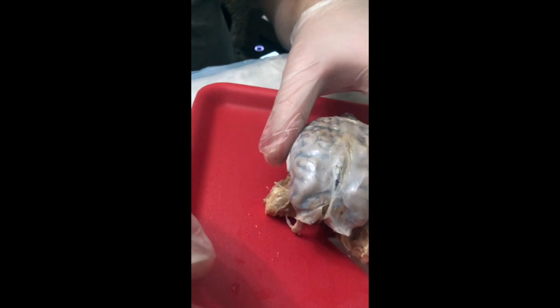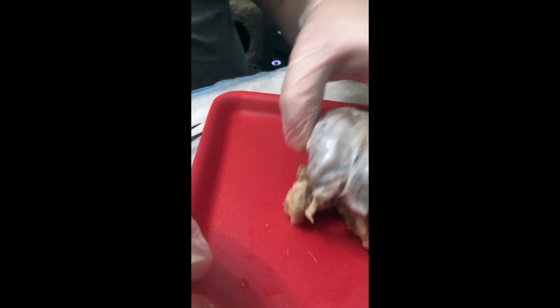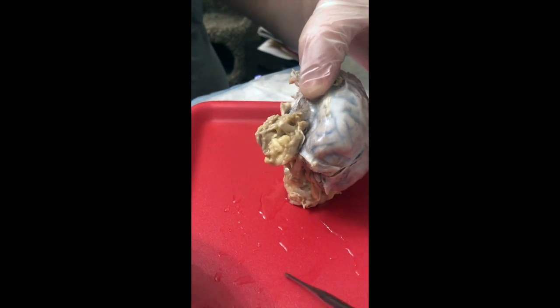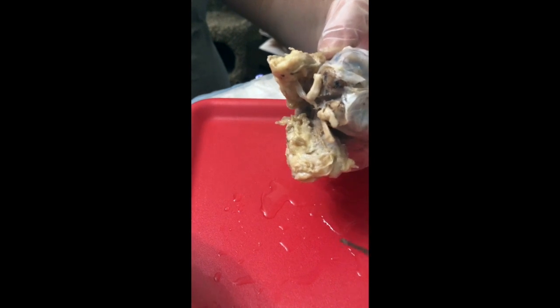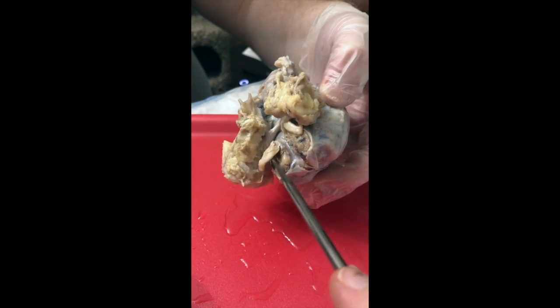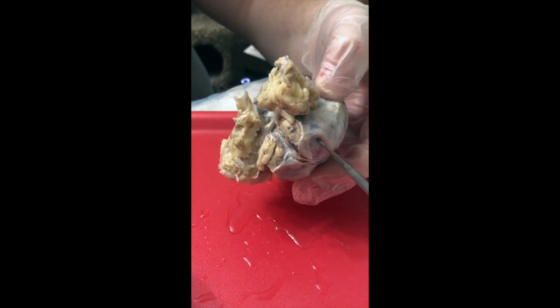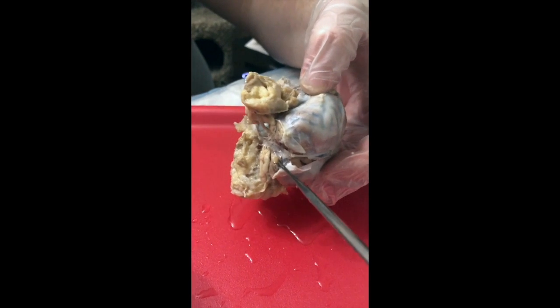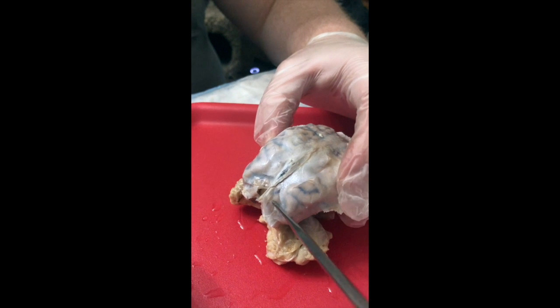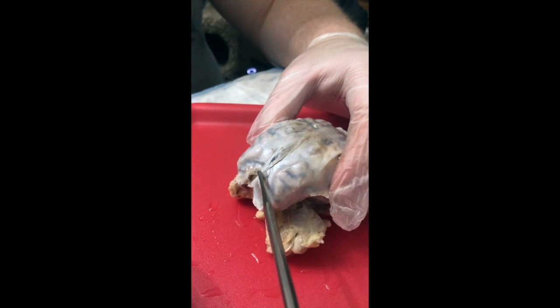On the anterior end, which will be the tip of the frontal lobe, we have two large fat pads, and those fat pads are going to be the cushions that sit at the orbit of each eyeball. Underneath, in these lighter structures, we see the cranial nerves coming off of the inferior surface of the brain, and covering over the entire cerebral surface and cerebellar surface, we have this thick, white, pearly covering.